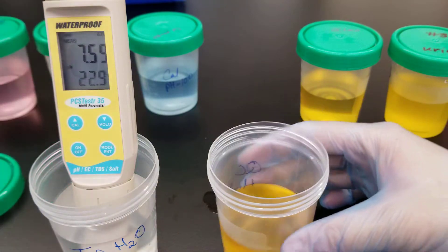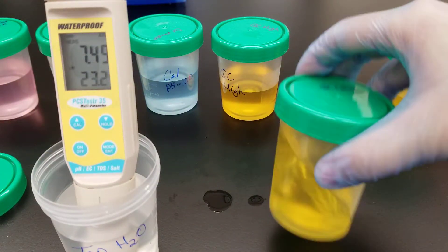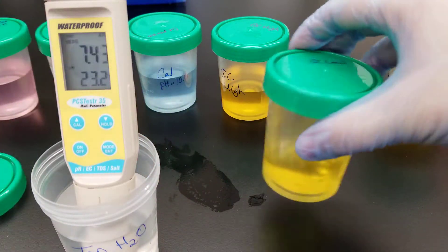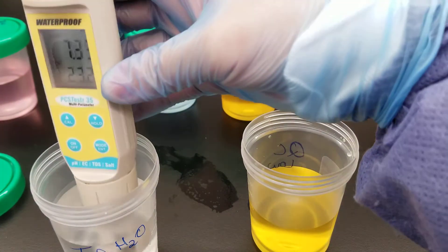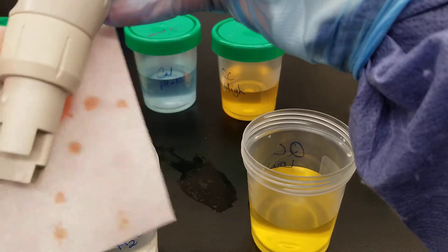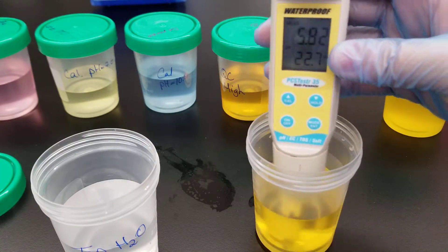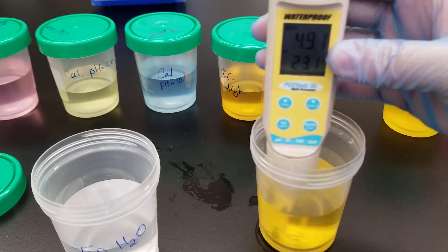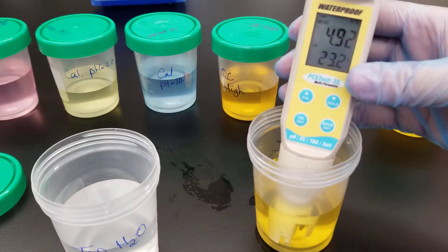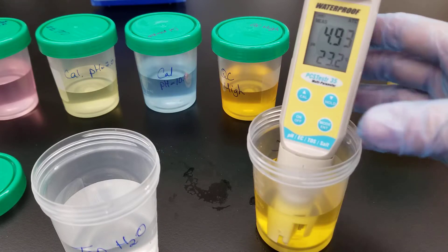Using a fresh pad, we're now moving forward to the low QC. Stir it around, let it stabilize, and the low QC measurement is done.